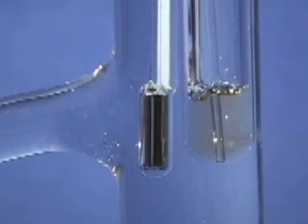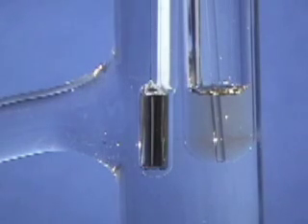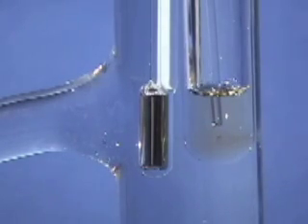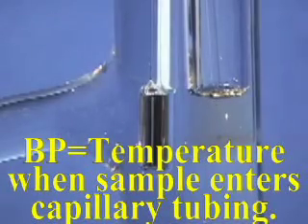As the sample cools, its vapor pressure drops and the stream of bubbles will slow down and eventually stop. At the point where the liquid enters the capillary, the vapor pressure of the liquid is assumed to have dropped just below the atmospheric pressure, and the temperature at this point is recorded as the boiling point of the sample.